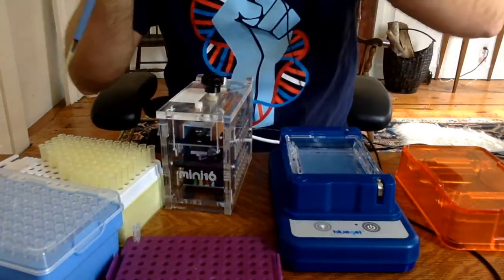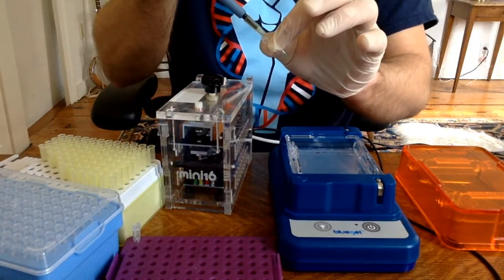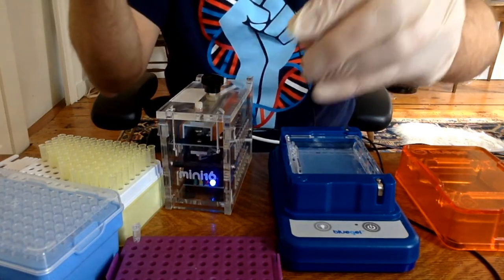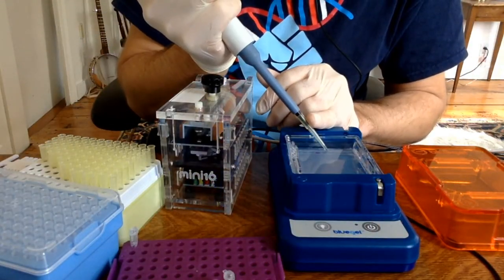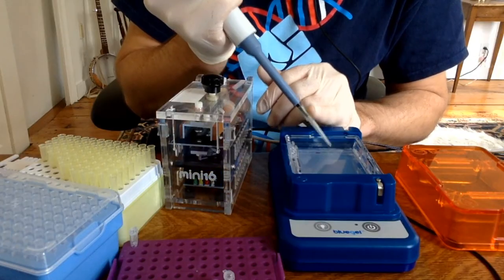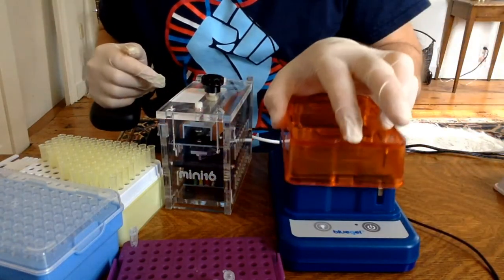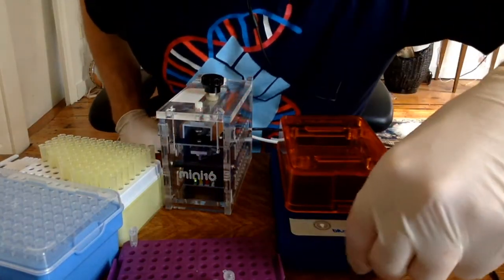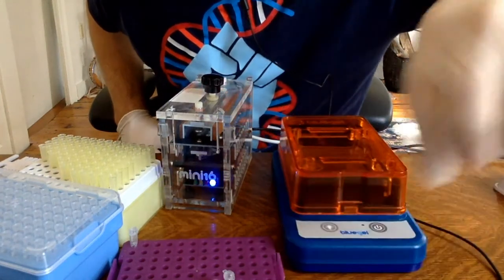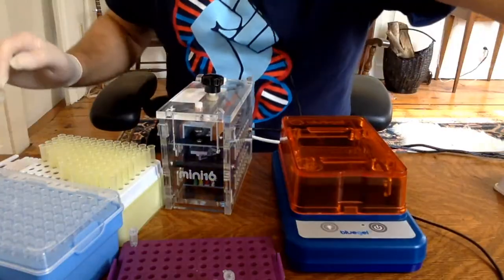And then finally, we're going to use the one that I restricted, 12 microliters of that, so we can run them next to each other. And now I have other results for my whole family to show you, but I do just want to show you how quickly this can run, and that we will be able to see some results that I'll try to show you by the time we're done. We just pop the top on, and we hit the power button, and that light means that it's running. All right, so we're loaded, it's running.